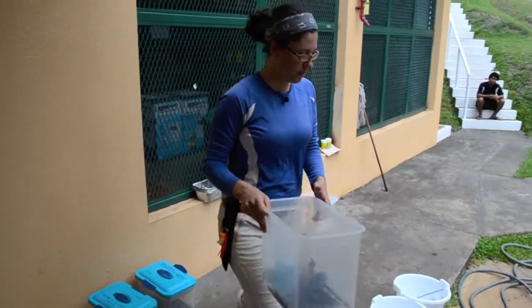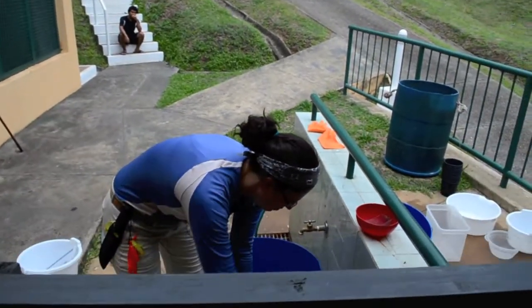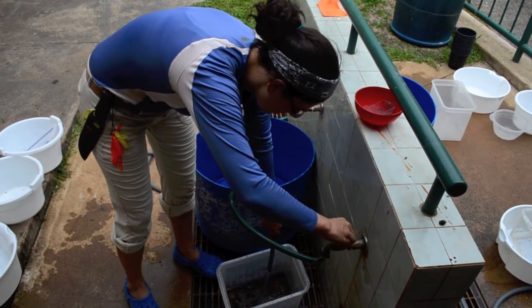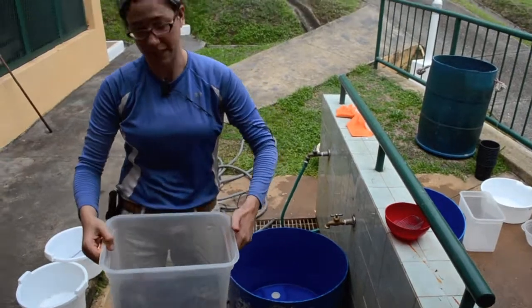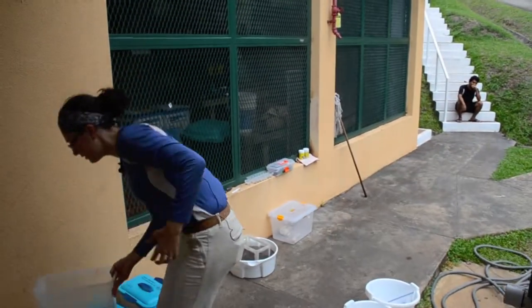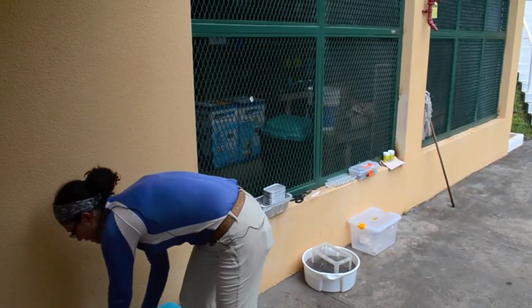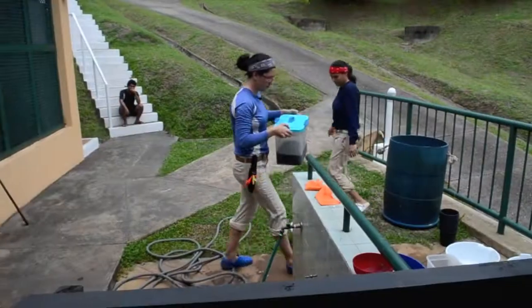So now put some water in here. So I've got enough water in this box to make sure that the whole sample is wet. And we're going to leave this one here to soak because it needs to soak for 10 or 15 minutes, and continue on with one that's already been sitting here soaking for a while.